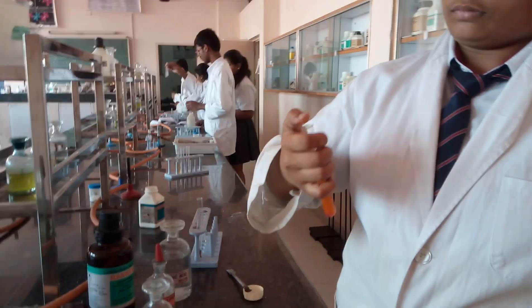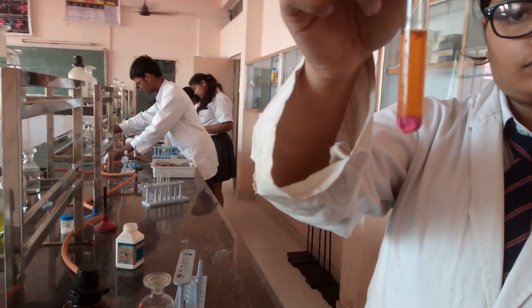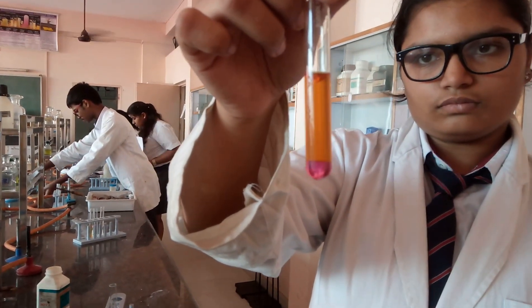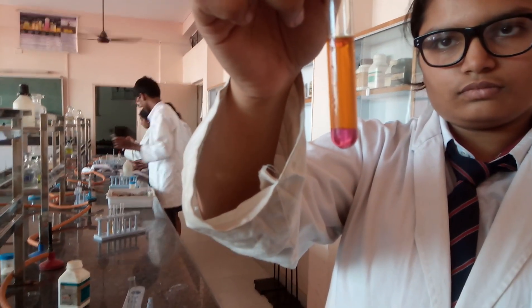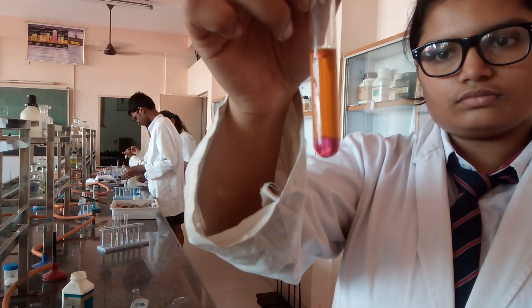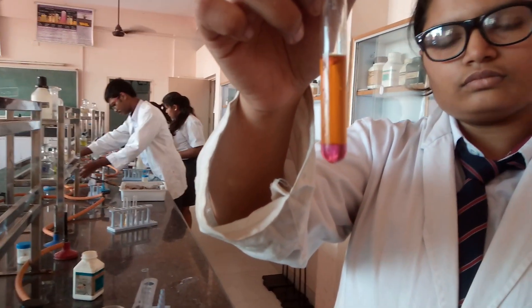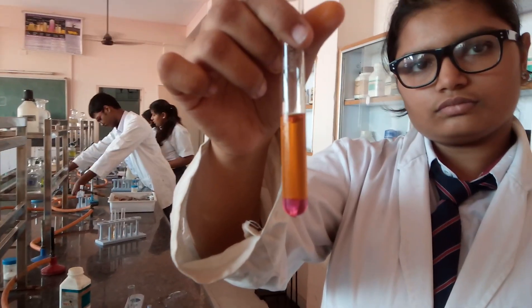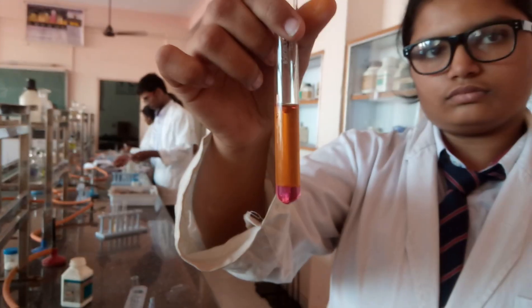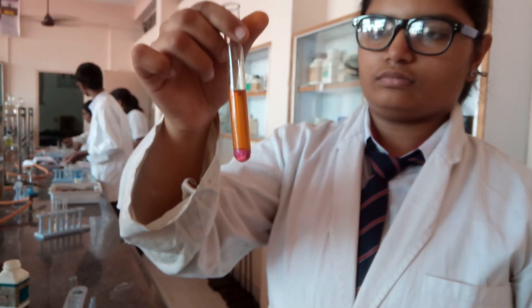I₂ is a covalent compound which starts dissolving in the organic layer. Since the organic layer is the lower layer, the lower layer turns violet, indicating that I₂ is formed — confirming that the original solution contained I⁻. The organic layer test for iodide is complete, where the organic layer turns pinkish violet. With this we close the test for iodide. Thank you.